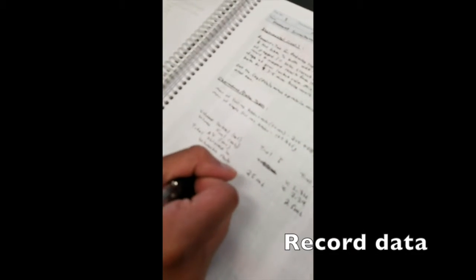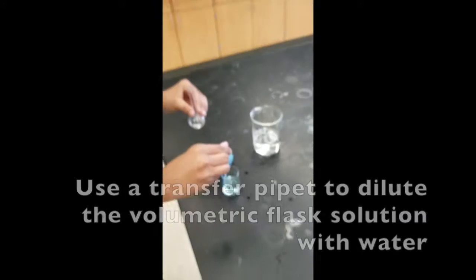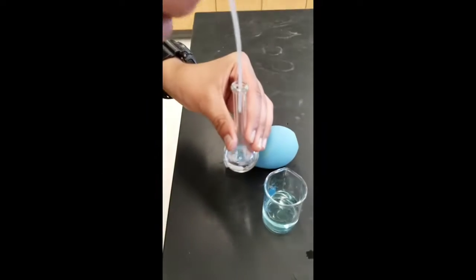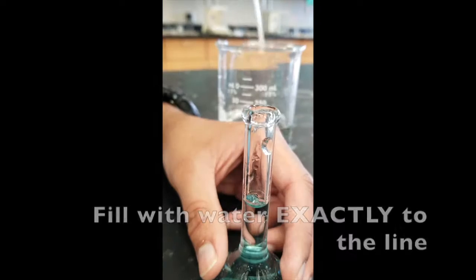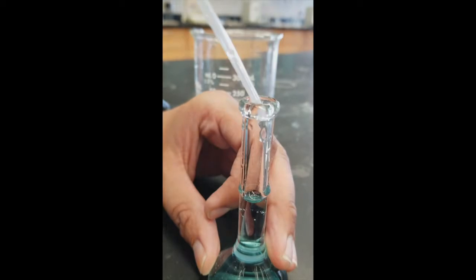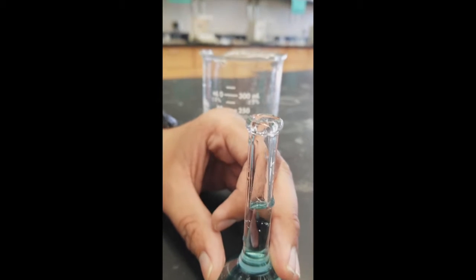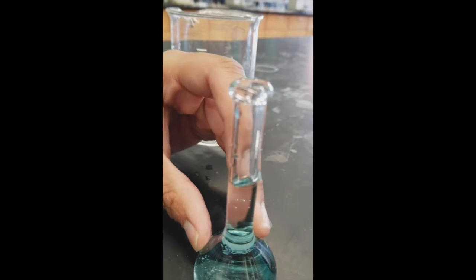So, and I will use a transfer pipette for that. And as you can see, it is a bit short, so just add a bit more. So it is, the meniscus is at the line, so we have exactly 25 milliliters. So our dilution is done.